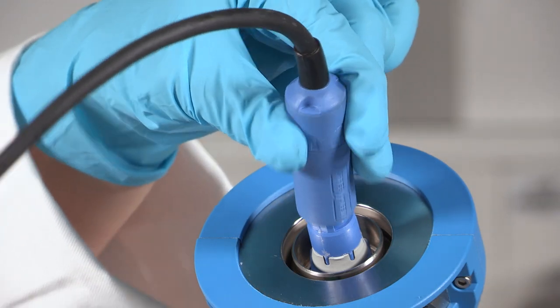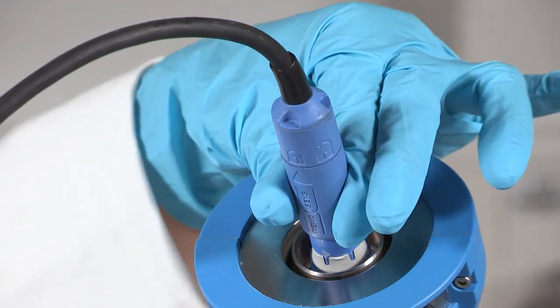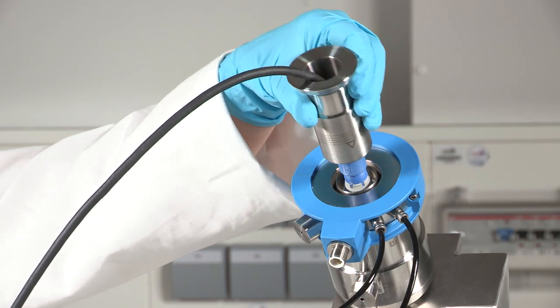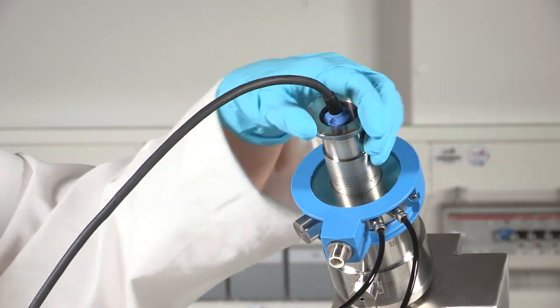Connect the cable coupling to the sensor and remount the retraction pipe.